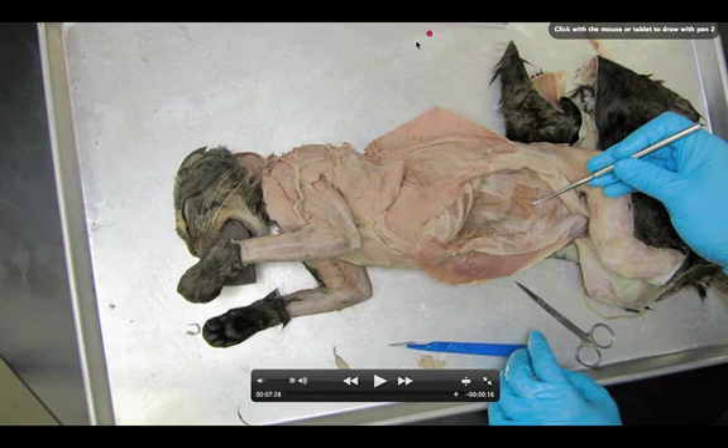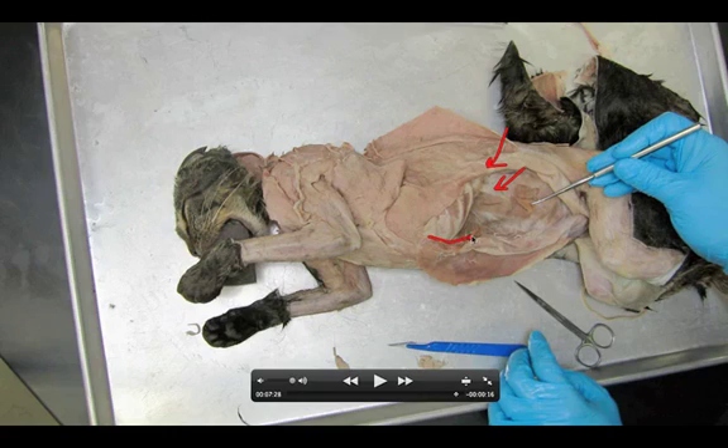Let's label all the muscles so we see what we're looking at. On the outside here we have the external oblique. Here we have the internal oblique. Lining this little ribbon here is the rectus abdominis. And then inside my little window I have the transversus abdominis. That pretty much sums up this dissection — it doesn't take too much time, you just have to be very careful making that window. Good luck, and we'll see how you guys do in class.